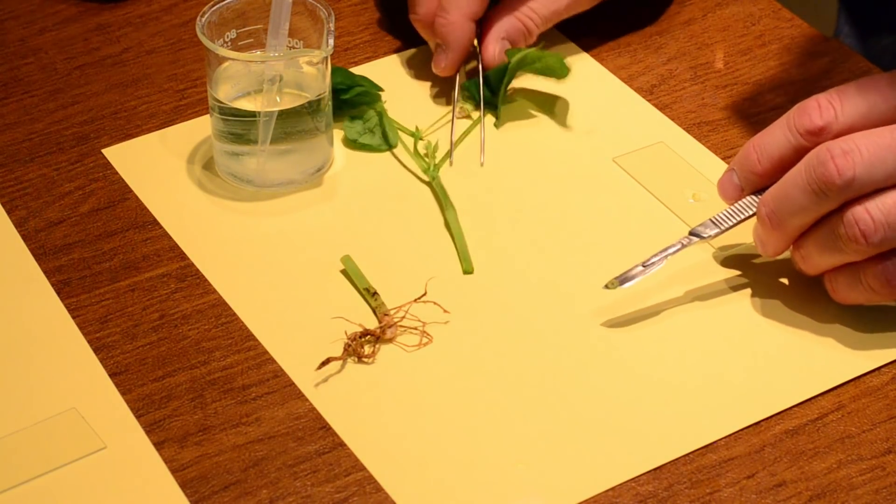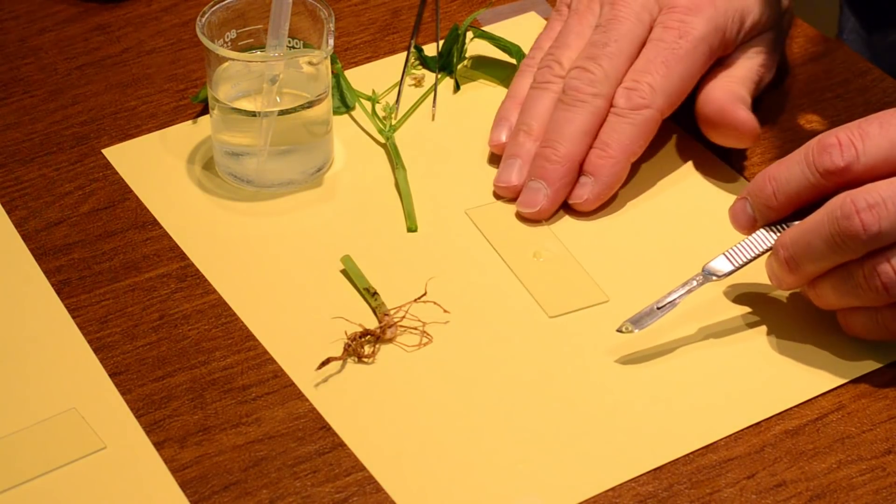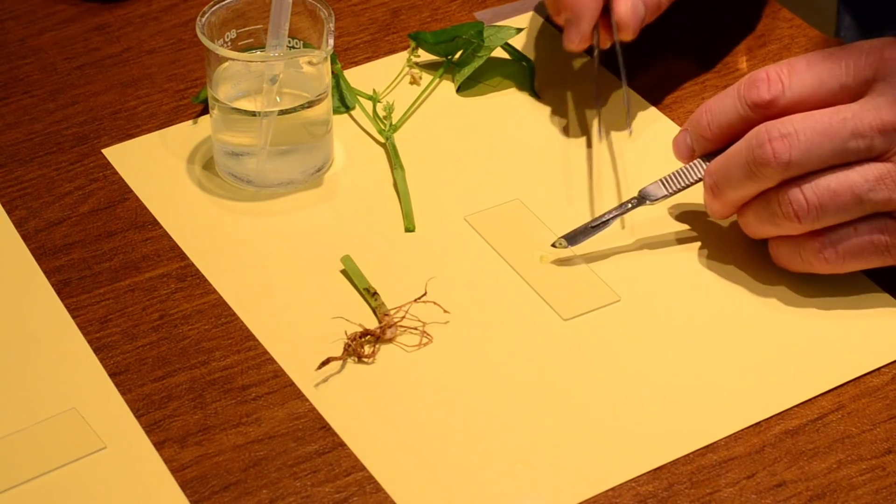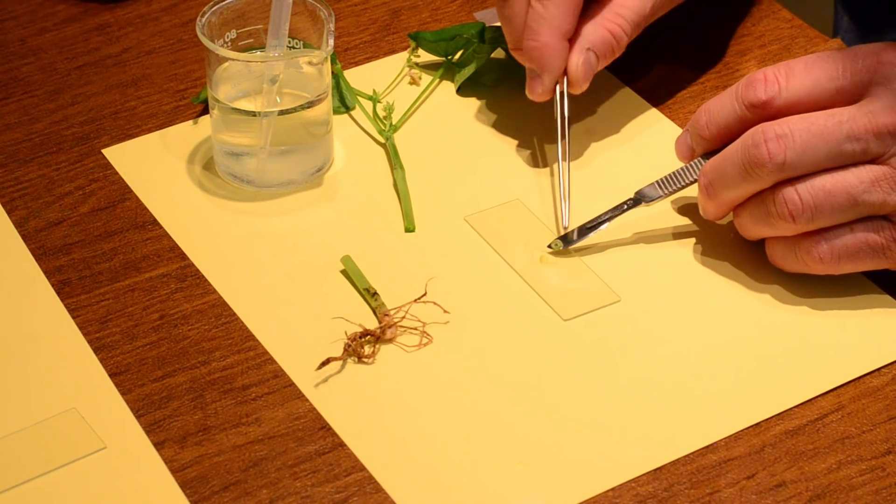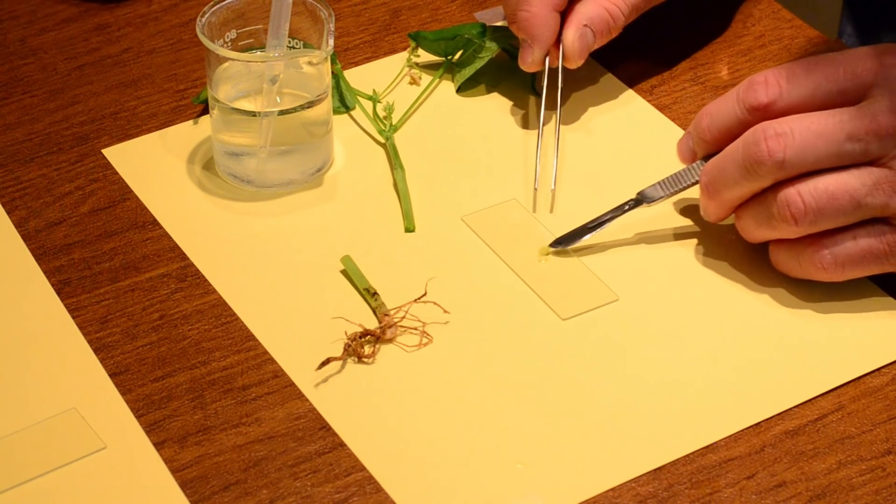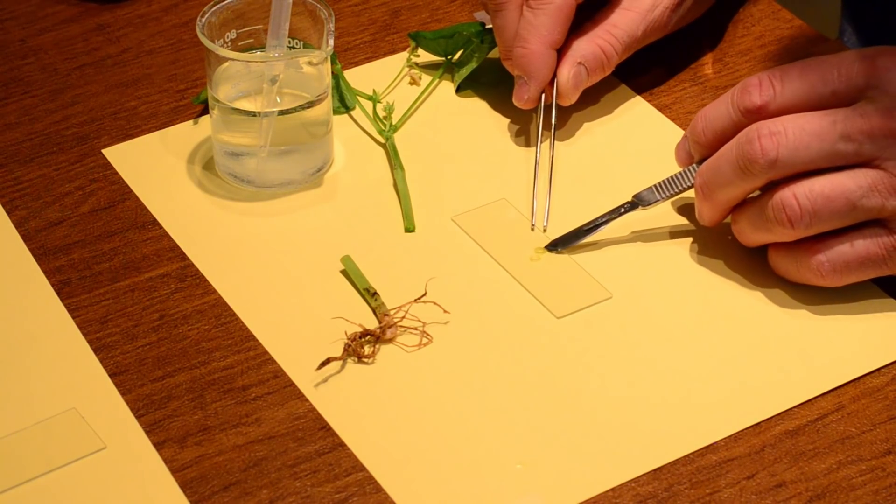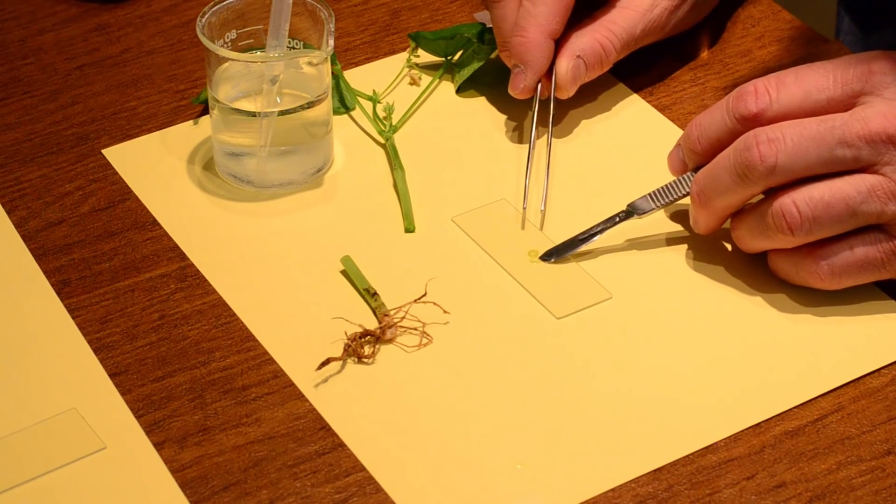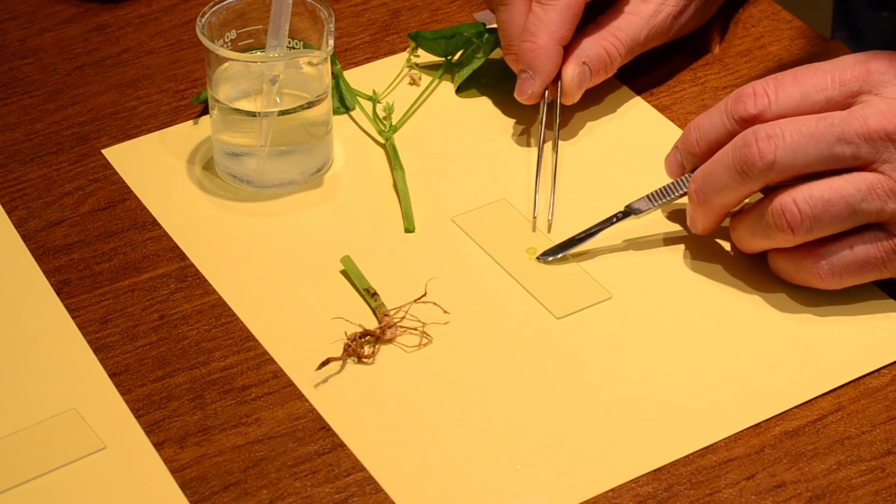And I have, this one's a little thicker. You might be able to tell that it's a little thicker. I never touch the scalpel blade with anything but the forceps. That one's a little thicker, isn't it? I can see those tubes. I can see the tubes that are used to transport food and water.